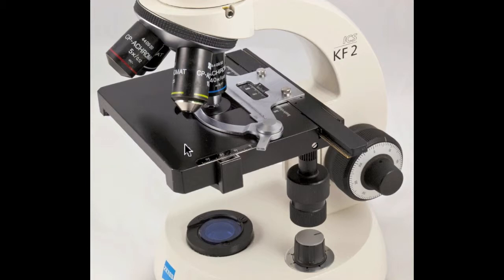This is the stage, with its slide holder. These knobs allow you to move the slide with great precision. And here are the focusing knobs. Finally, on the base is the light adjustment knob.